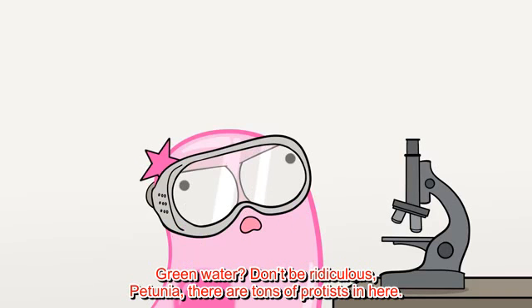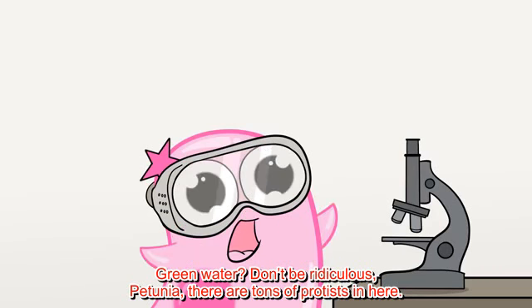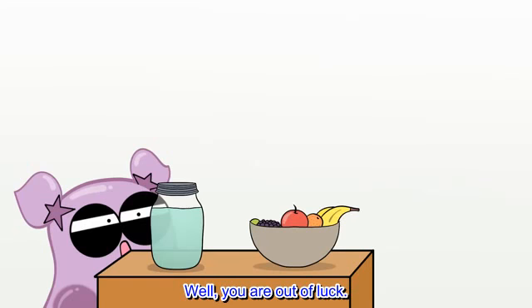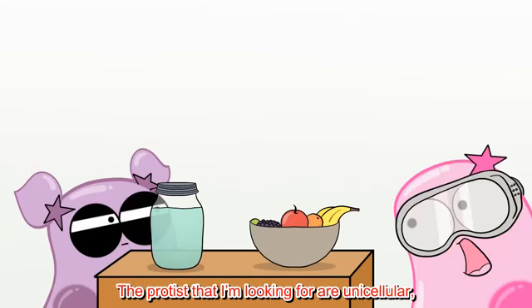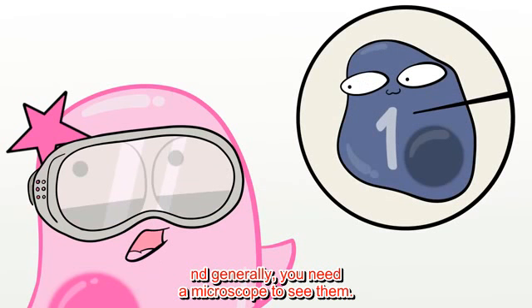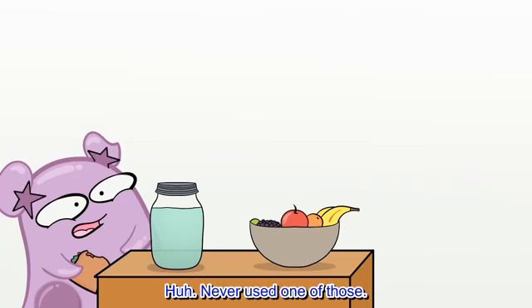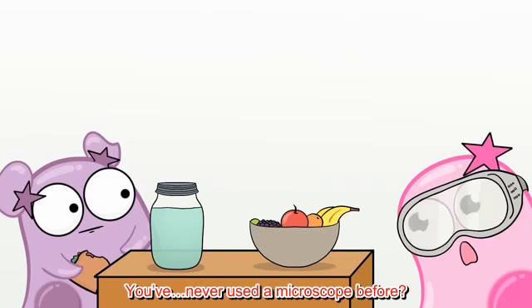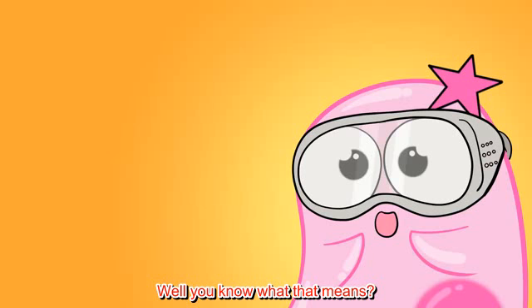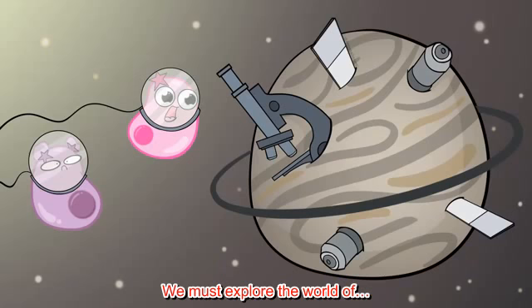Green water? Don't be ridiculous, Petunia. There are tons of protists in here. We just have to find them. Well, I think you're out of luck. The protists that I'm looking for are unicellular, meaning they're made up of one cell. And generally, you need a microscope to see them. Huh. Never used one of those. You've never used a microscope before? No. Well, you know what that means. I'm afraid of what that means. We must explore the world of microscopes.